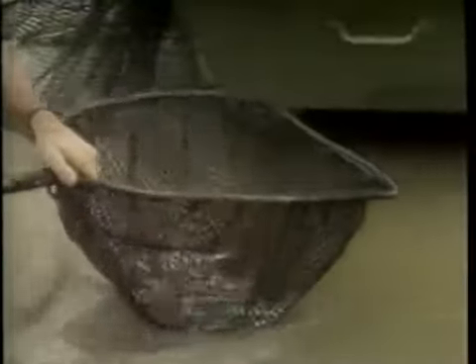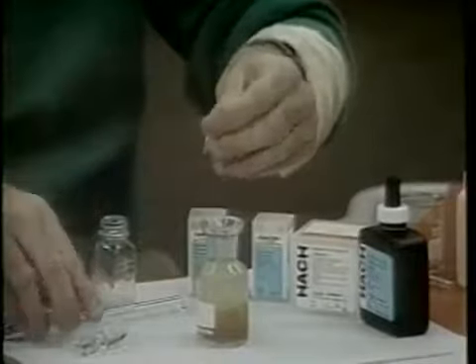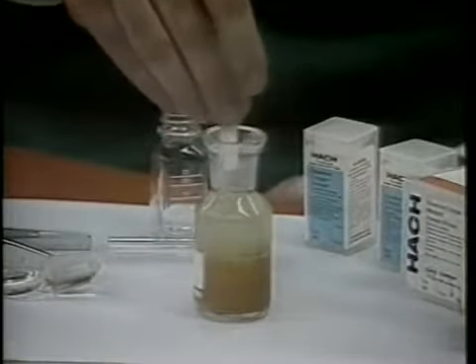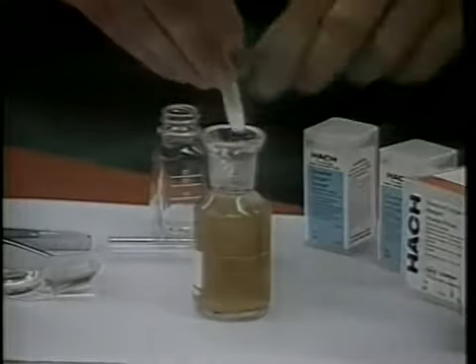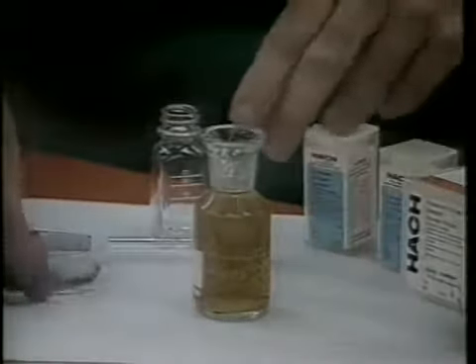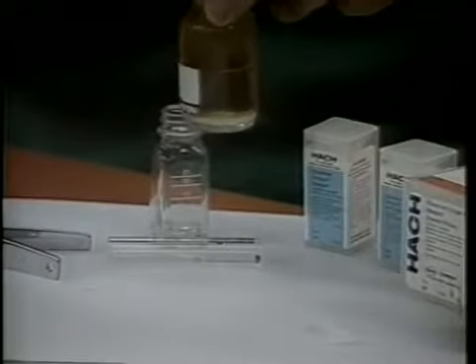As mentioned throughout this video series, successful fish production is dependent on the quality of water present. Tapes 1 and 2 of this series have introduced important water quality parameters and their influence on the biology and chemistry of a typical fish pond. However, in order to properly manage the water quality of a pond, methods of measurement of the various parameters must be understood. Therefore, the purpose of this tape is to describe the testing procedures for the water quality parameters which were discussed in tape 2.